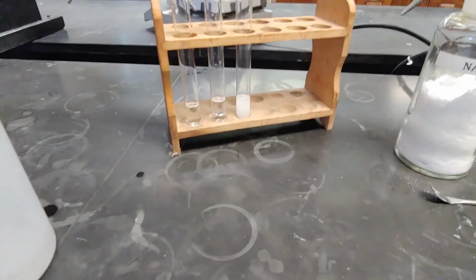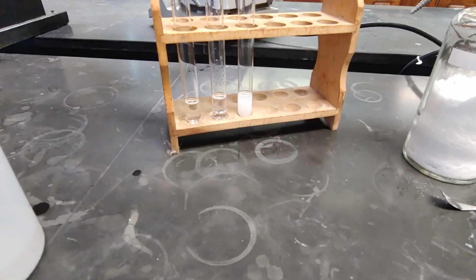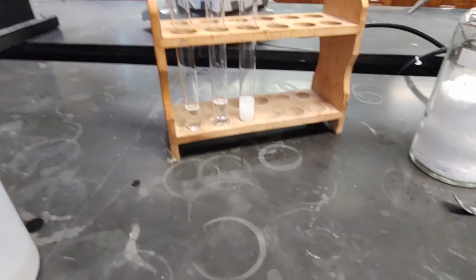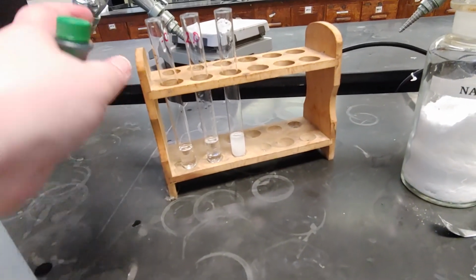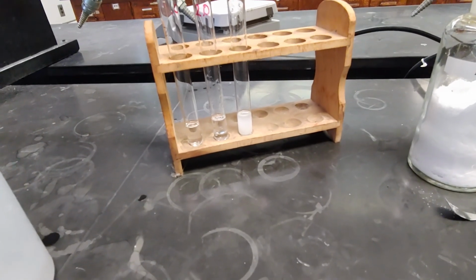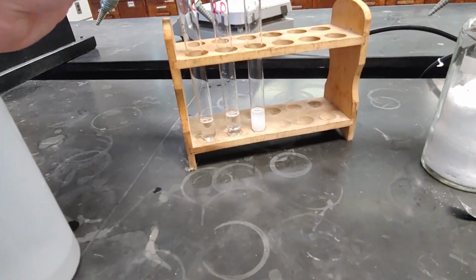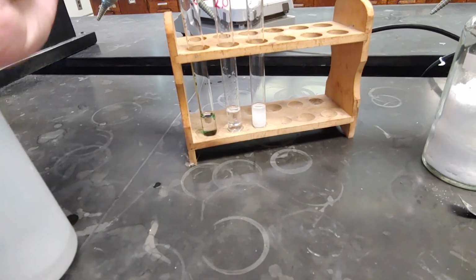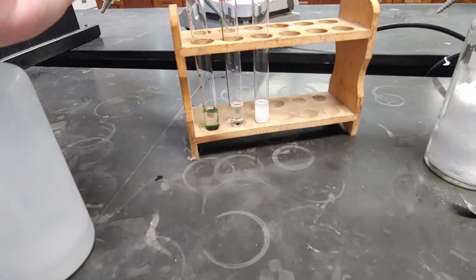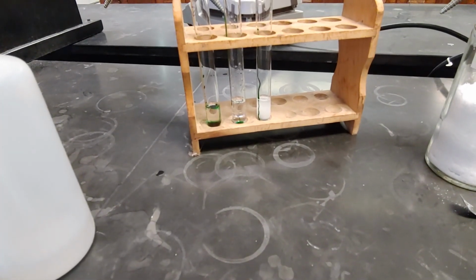And those are our three solutions. If you forget what they are, then you can just go back to table 3 in your lab, and there's a list of exactly which is in what test tube from left to right. Now, sometimes it can be hard to tell if things are miscible or immiscible, and when I can, because it's fun and why not, I like to use food coloring. Food coloring mixes with water, and if water mixes throughout the entire solution, then that means that there's water throughout the whole thing and the two solutions have mixed.